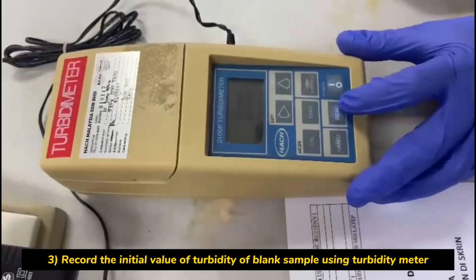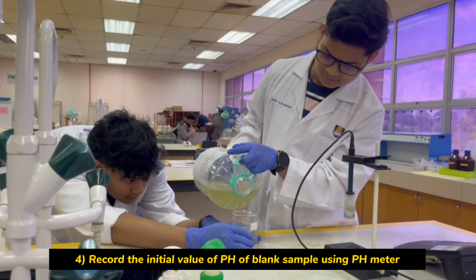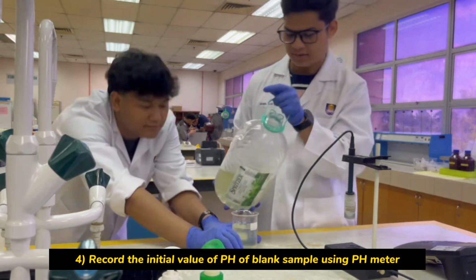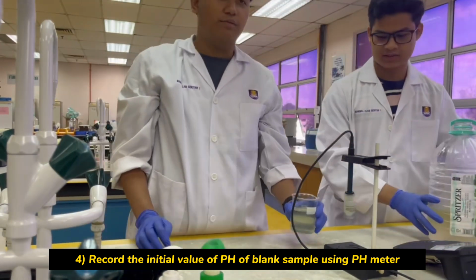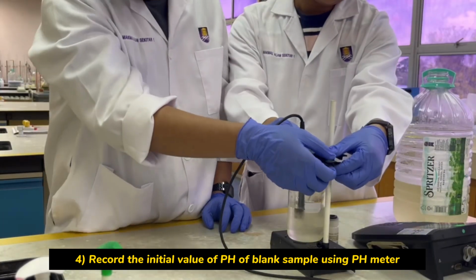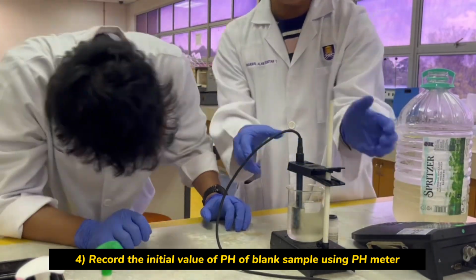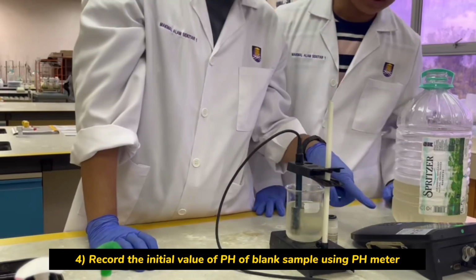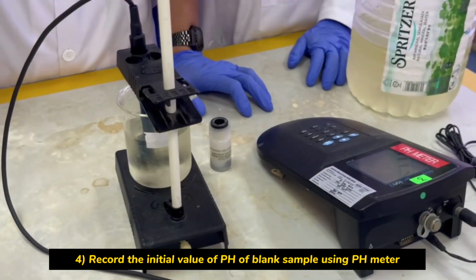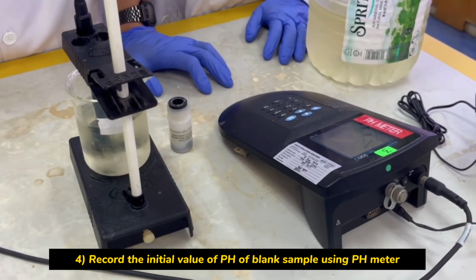Then record the data. Record the initial value of the pH meter. Pour the water sample into the beaker. Clean the pH stick using distilled water before inserting it into the beaker. Click the read button at the pH meter to get the pH value.